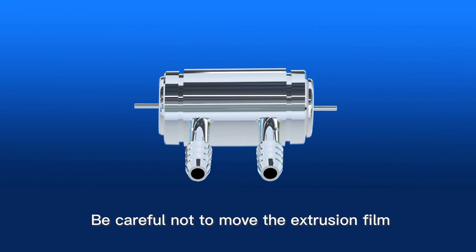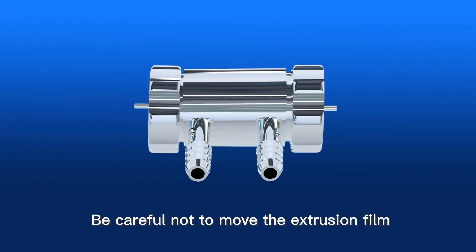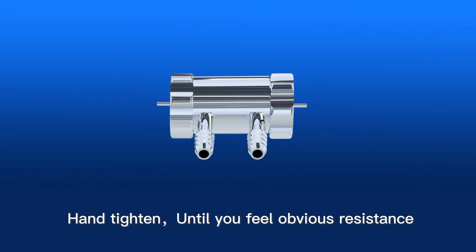Screw on the container nut. Be careful not to move the extrusion film. Hand tighten until you feel obvious resistance.